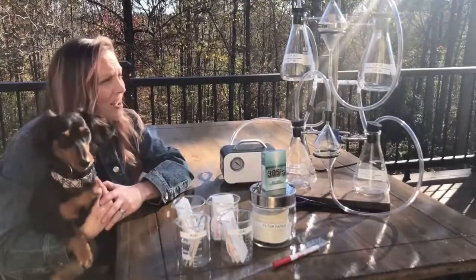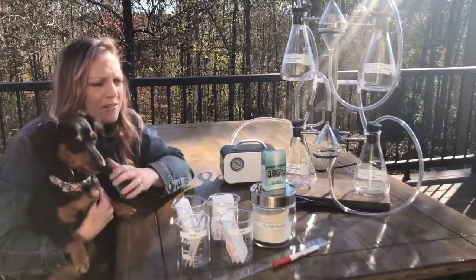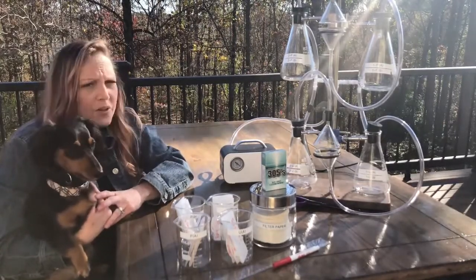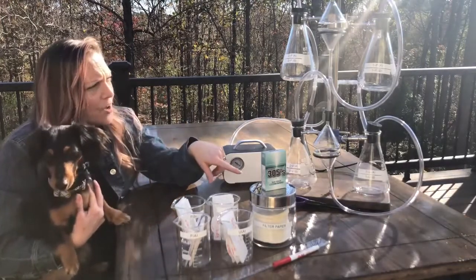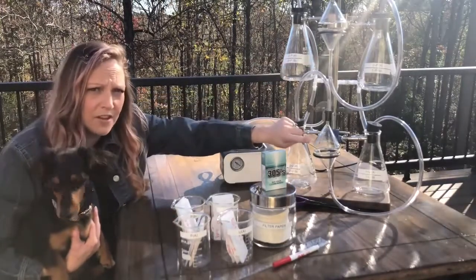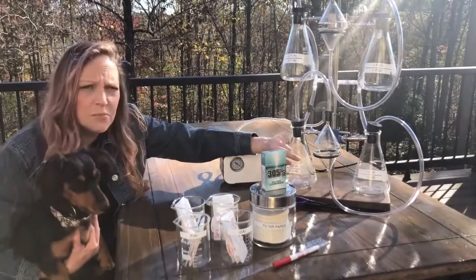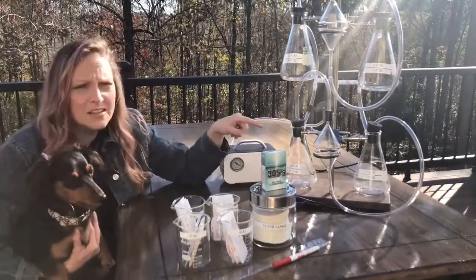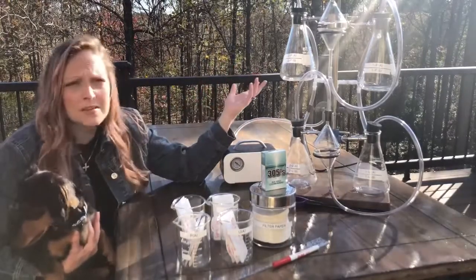So I wanted to make sure you guys got to see it and see it working, so I'm going to hope that the wind cooperates and it's not too windy. So an explanation of what we're doing today: we are going to do two trials, trial A and trial B. We're going to run a filtered cigarette up here and an unfiltered cigarette down here. And we're going to test both first-hand smoke, like what would be consumed by a smoker, him or herself, and second-hand smoke, which would be what's consumed by those of us who are in the presence of someone who is smoking.